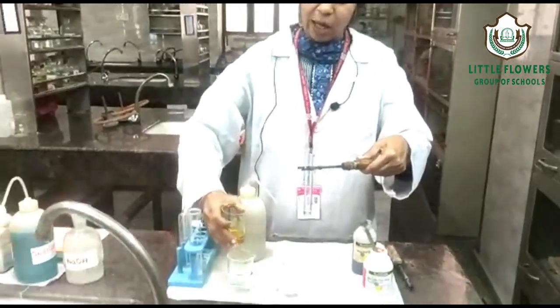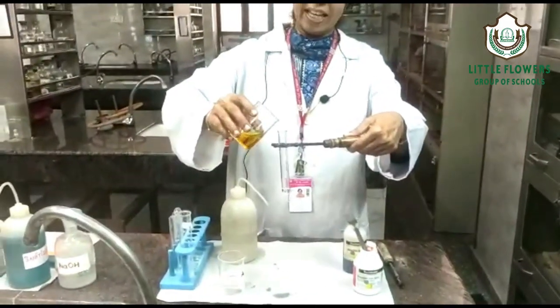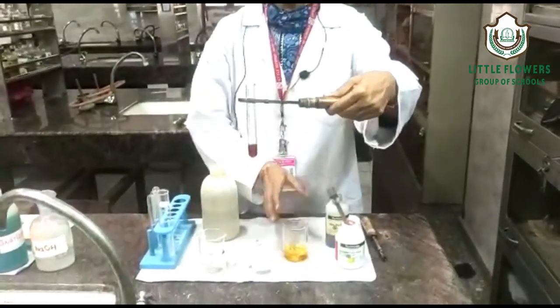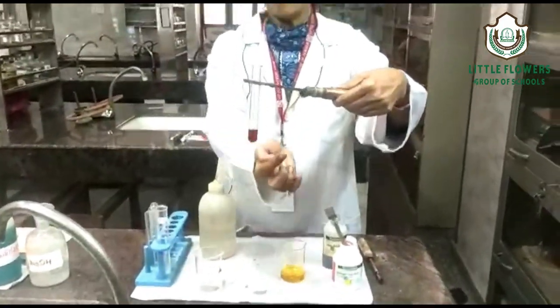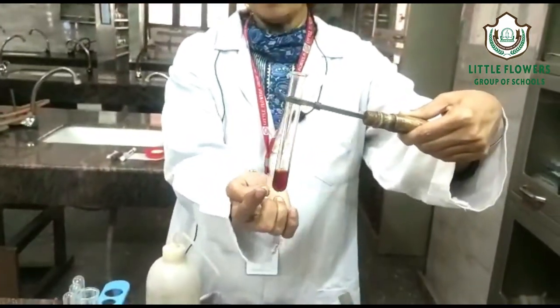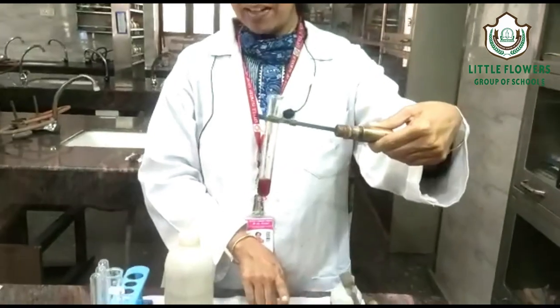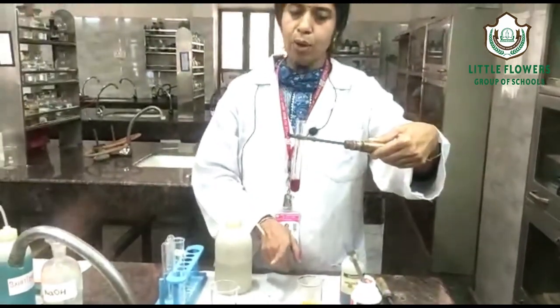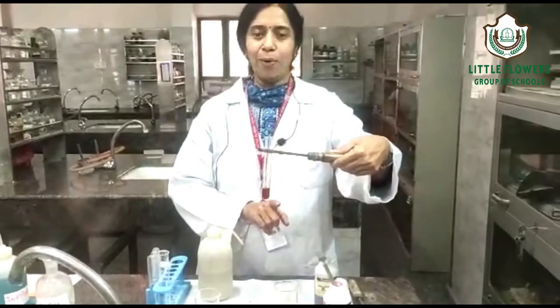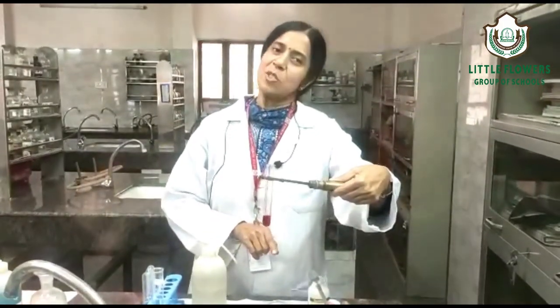We add the ceric ammonium nitrate solution to the organic compound already taken in a test tube. We are adding it. You see a red wine color appears. After adding ceric ammonium nitrate in the organic compound, it shows that the alcoholic functional group is present in the given organic compound.